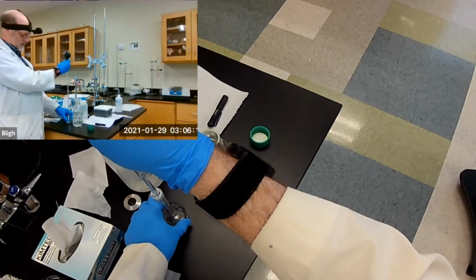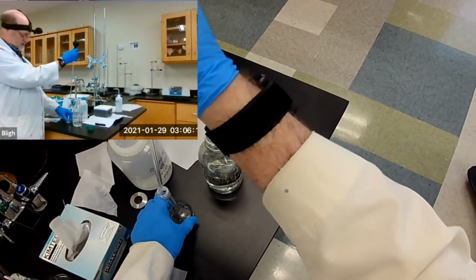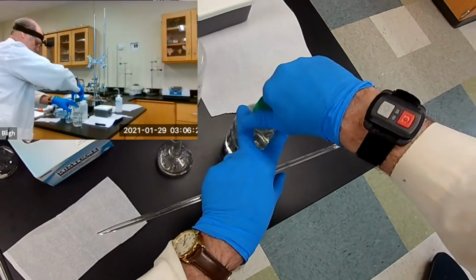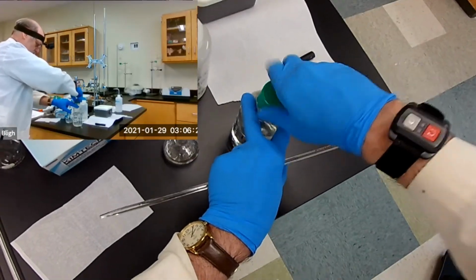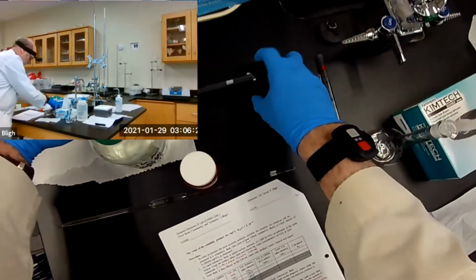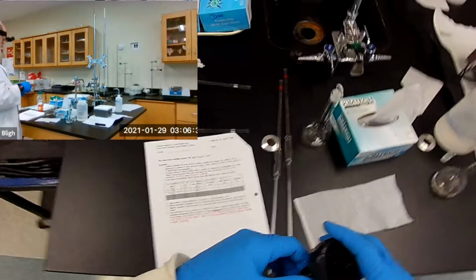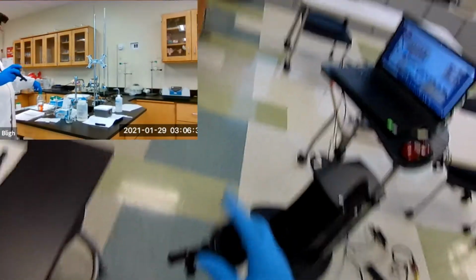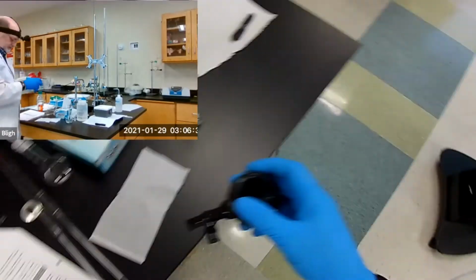And now we touch the tip, and that one's done. So we're going to seal this up. There we go. Set it aside with the pipette separated, so we might need to use them again. Well, actually, we won't use the 5 milliliter ammonia again. The next time we use it, if we do, is 10 milliliters.